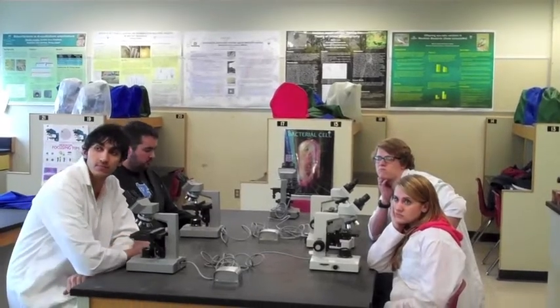Morning class! Today we'll be using the microscopes to help us understand a question. Why is a yellow spotted salamander's eggs green? Does anyone have an idea of why a yellow spotted salamander's egg is green?